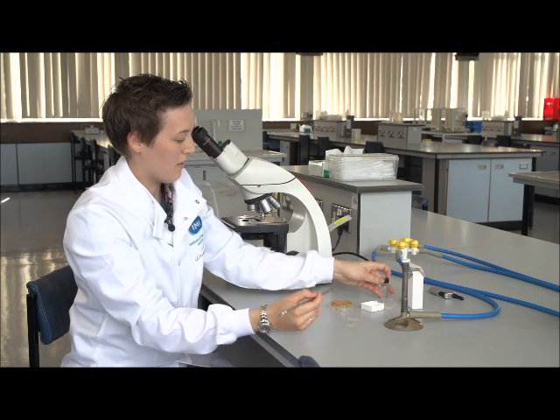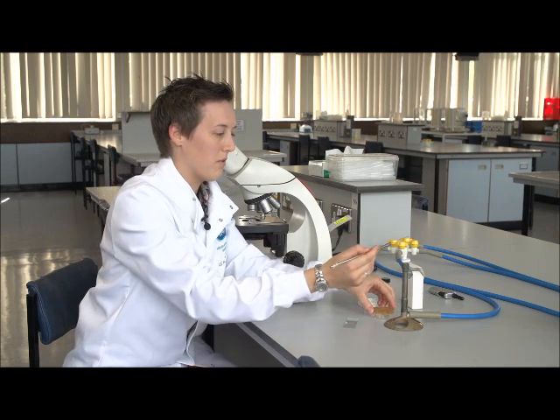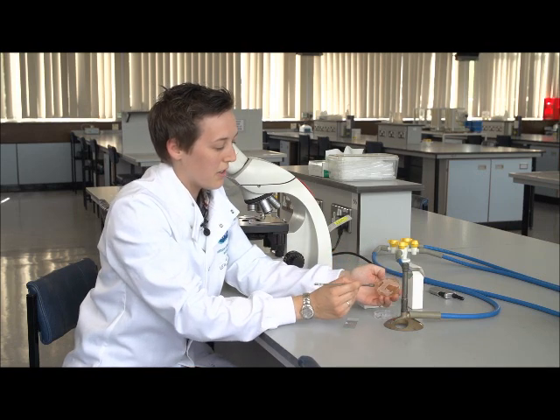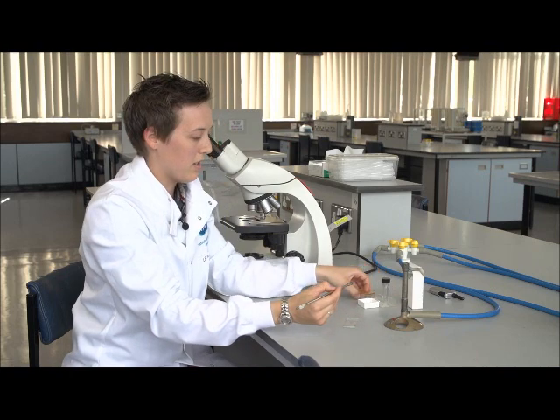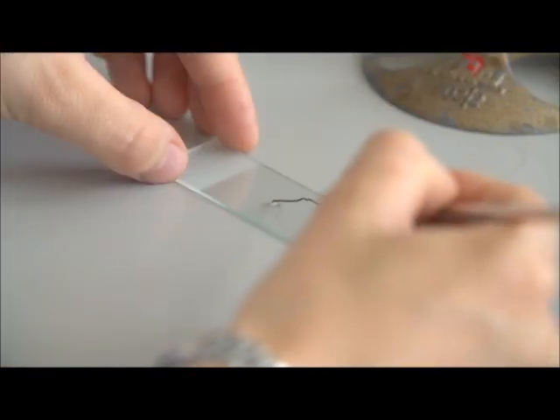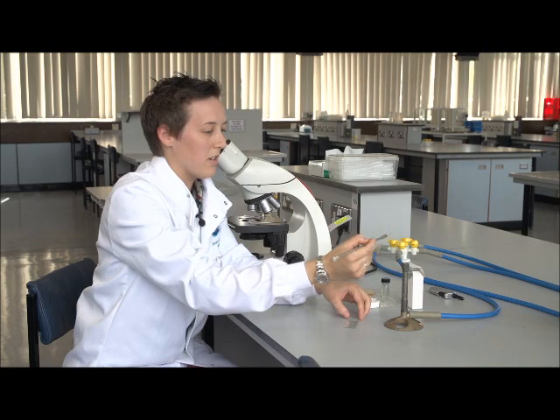Okay, and now we want to take up a very small amount of our yeast. So to do this, we flame our loop, cool it on the side of the agar first to take the heat out, pick up a small amount of our sample, place that back into the lid, and then simply smear some of that sample into the water that we've put on there. Flame the loop again so that it's uncontaminated and safe.